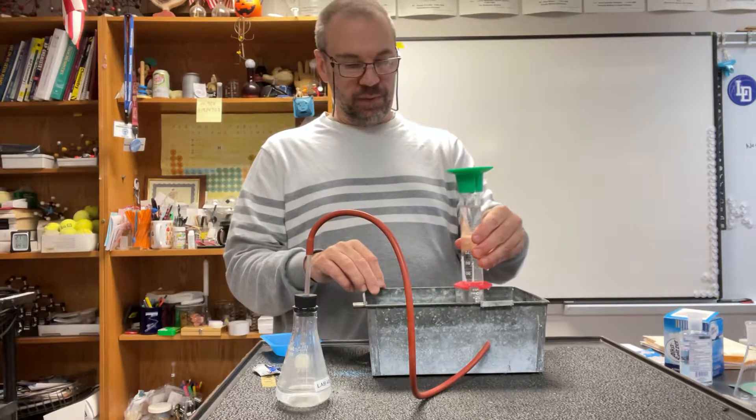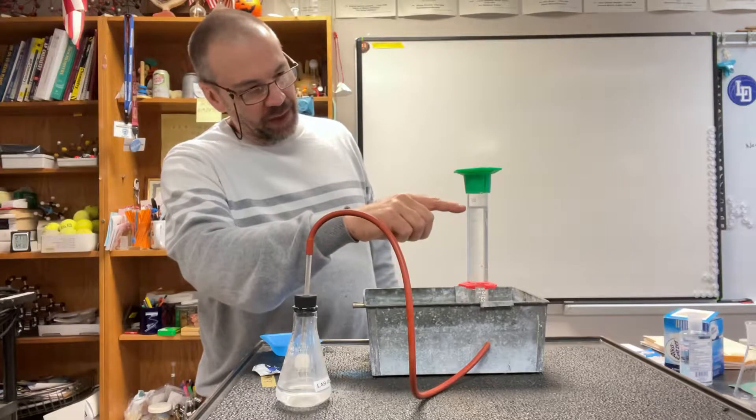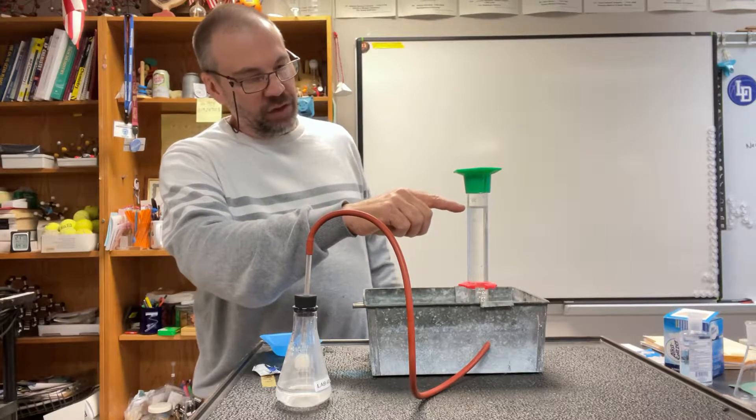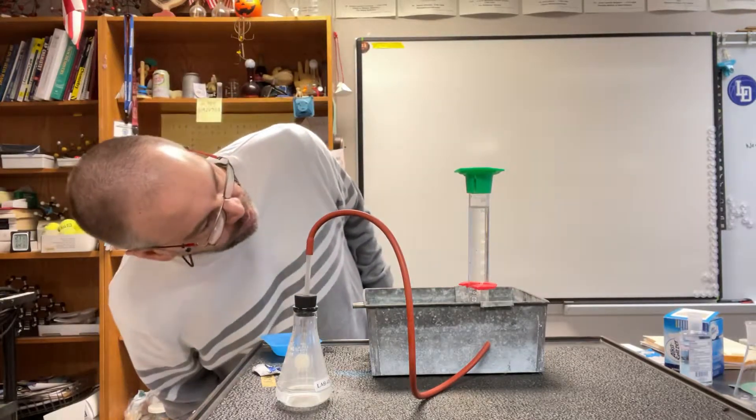Then we put that on our centerpiece, and I don't know if you can see it this well, but our beginning water level is right there. So I would mark that at 29.5 milliliters.